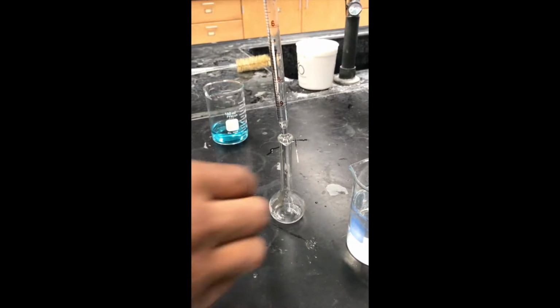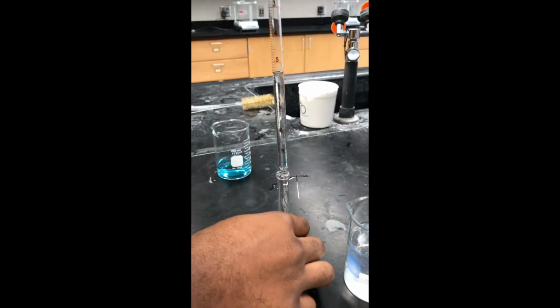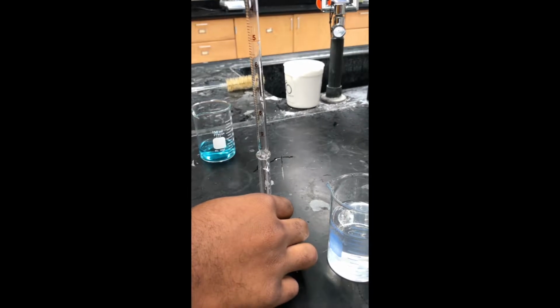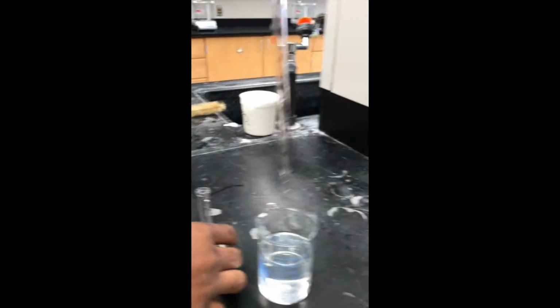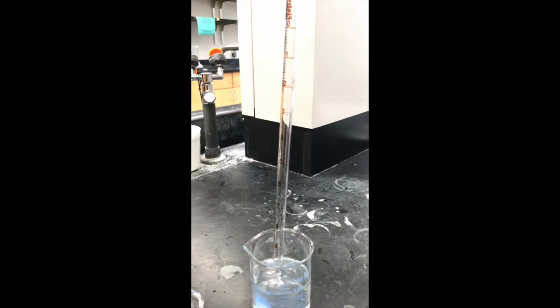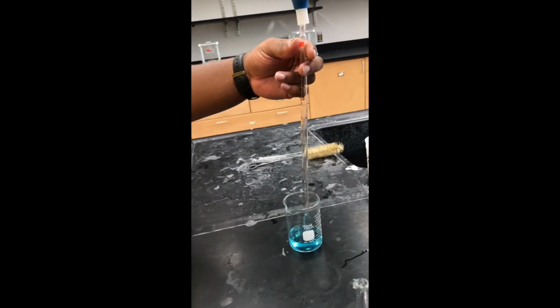Dilution is the process of reducing the concentration of a solute in solution, usually simply by mixing with more solvent. In this case, the solvent is water, and we will be adding more water to a smaller amount of the blue stock solution to dilute the stock solution and use it for our experiments.